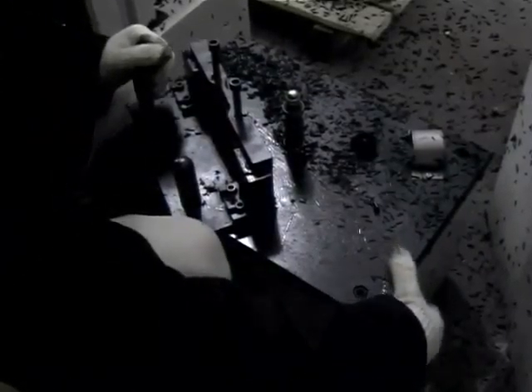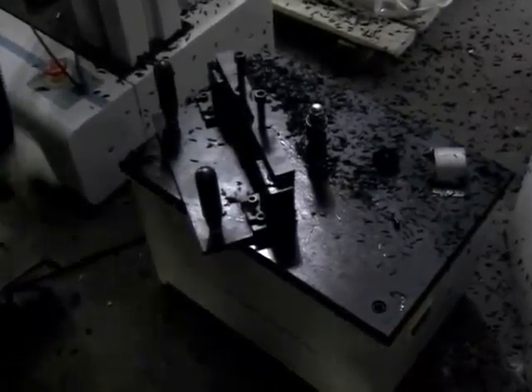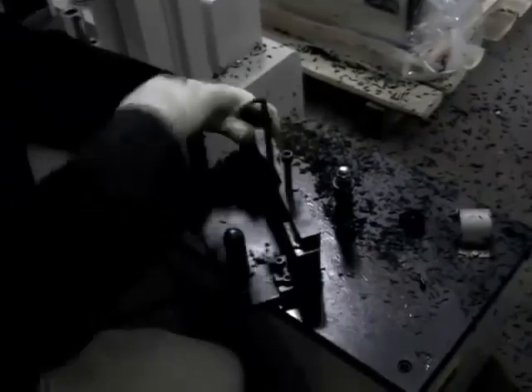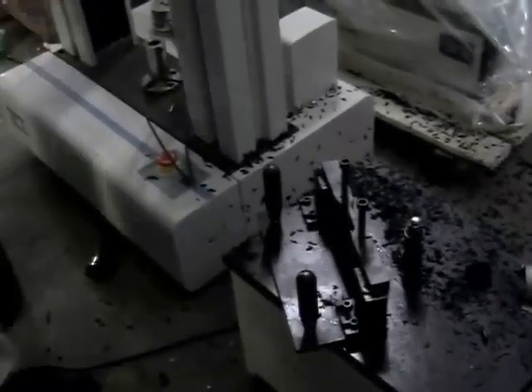And the sample making is finished. Stop our equipment. After that we will open the screw. Good. And our sample is ready for the tensile test. And we will take the sample.